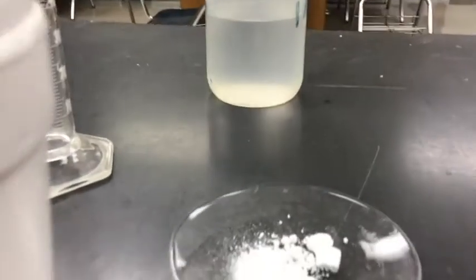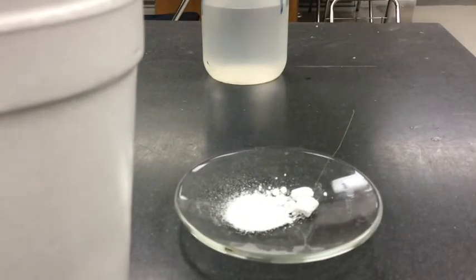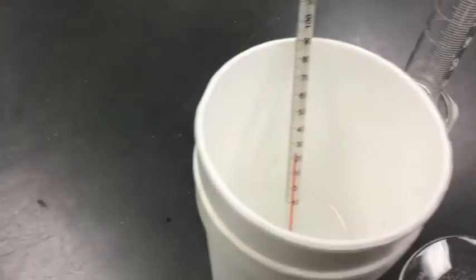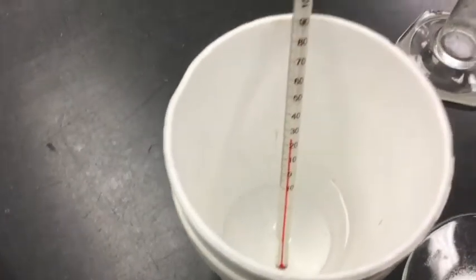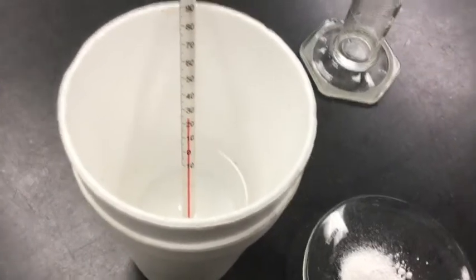Now, what's going to happen is that I'm going to take the magnesium oxide that is here and put that into that container, and we're going to get a chemical reaction out of it. And as the chemical reaction goes, it's actually going to be an exothermic reaction, which means that the temperature of this is going to increase. Because again, we are counting this as our system. It's losing energy, and we are figuring out how much energy my system is losing by measuring the surroundings, which is going to be the water that is in the hydrochloric acid solution.